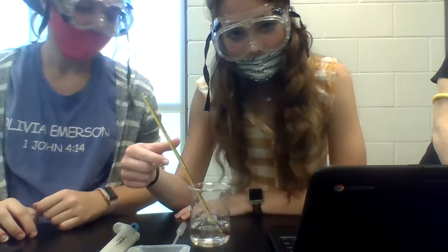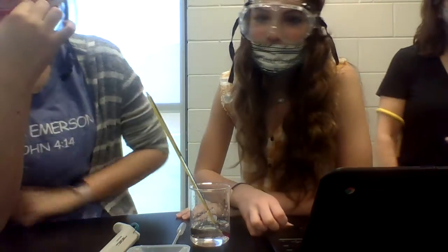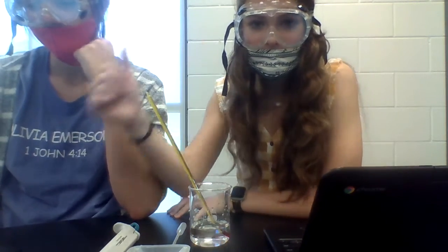So we're going to take the temperature of our water with our thermometer. And one more thing, graduated cylinders. And then we're going to get the data, calculate the density and the average density, record the temperature of your water, and then we'll be done.